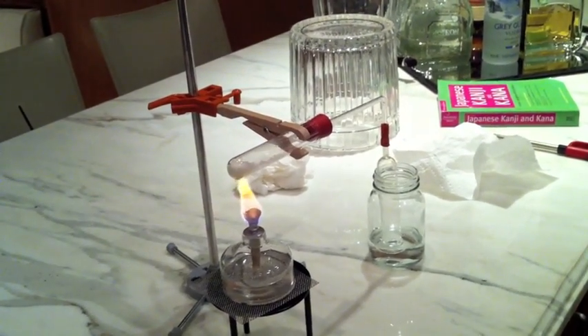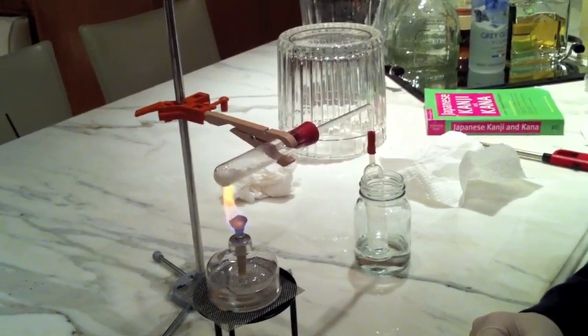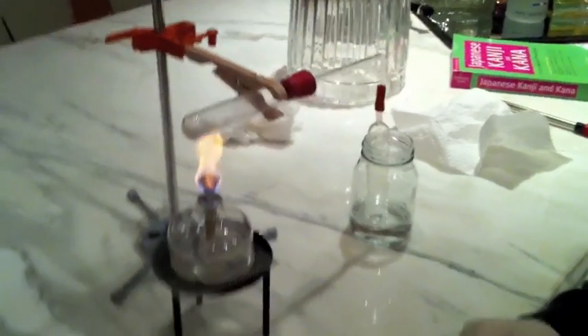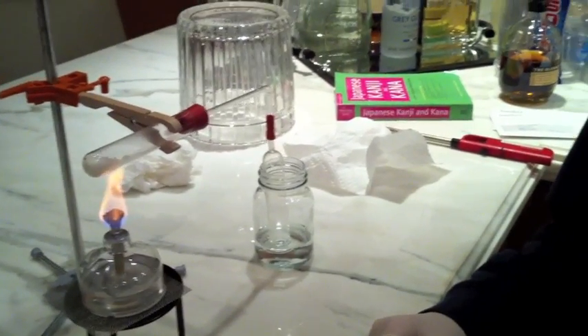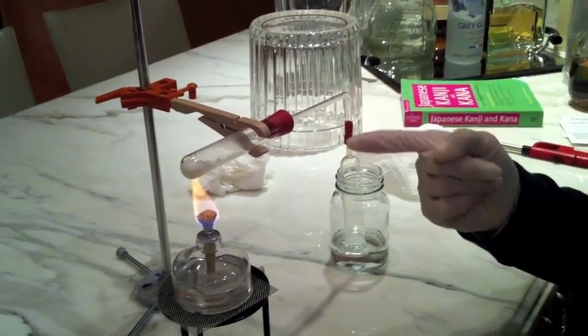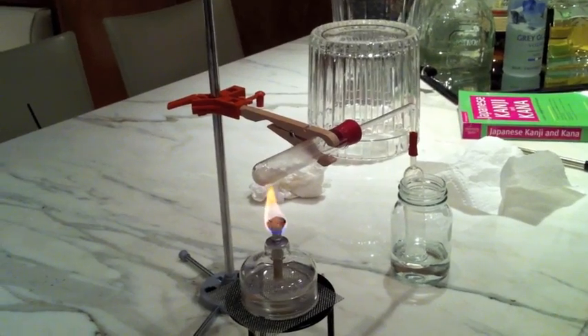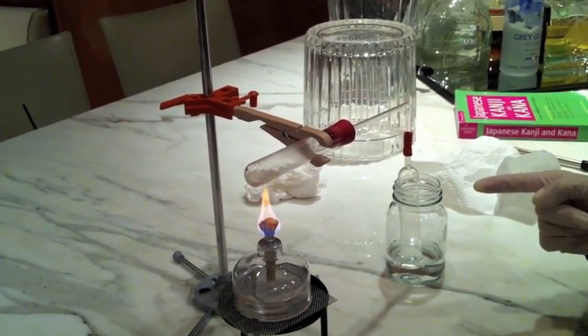The reaction occurring here — the burner is 70% ethyl alcohol by volume, and the solution of hydrochloric acid we'll be making will be 7% hydrochloric acid by volume. The sodium chloride here is with the sodium hydrogen sulfate, and that's going through a distilling apparatus.